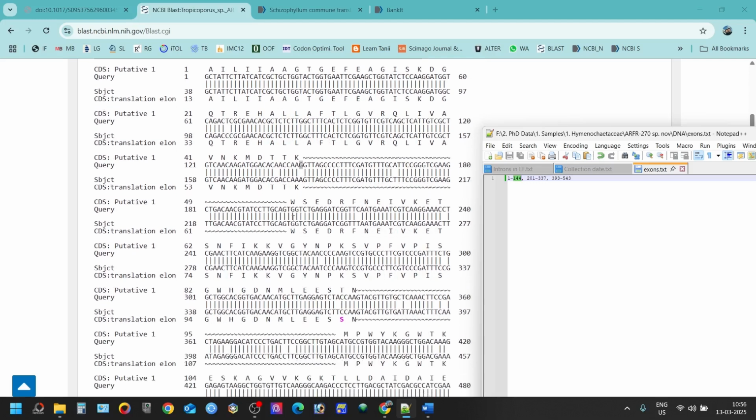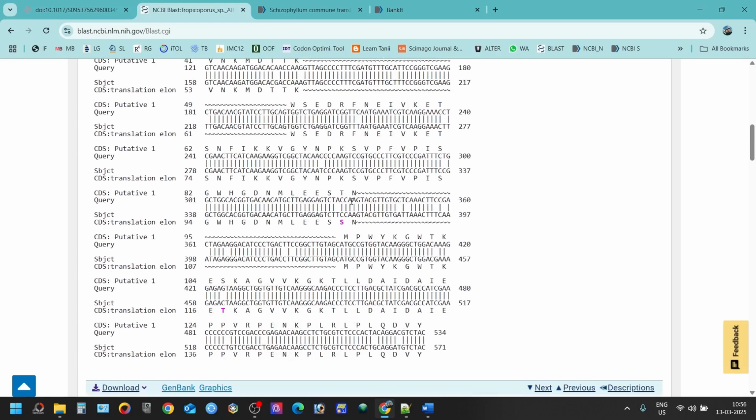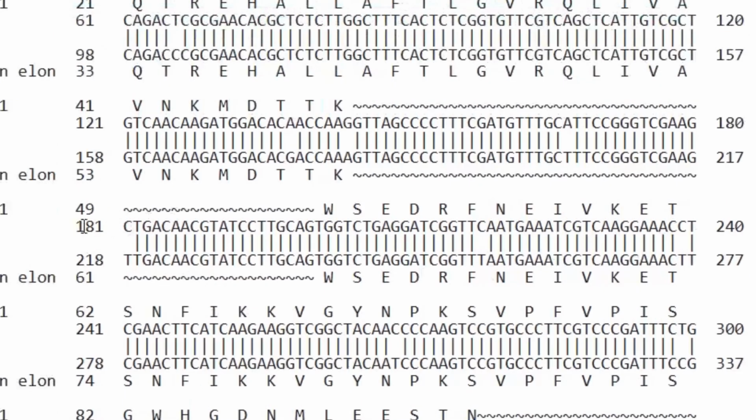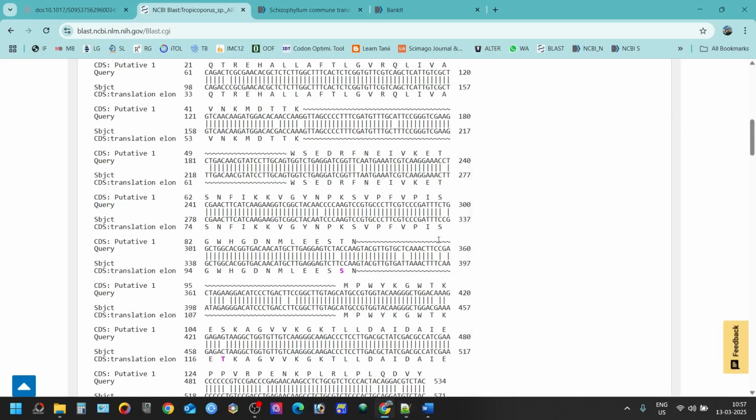Like that, you have to count from here. Then from here it starts your coding, the exons start from here. So you have to count from here to here, and I've also counted it, but let me count it if you are confused. For example, let's say this is your 181, 82, 83, 84, 85, 86, 87, 88, 89, 90, 91, 92, 93, 94, 95, 96, 97, 98, 99, 200. So from 201, it's your protein coding gene region. So you can see from 201 to 337. You can count it here.